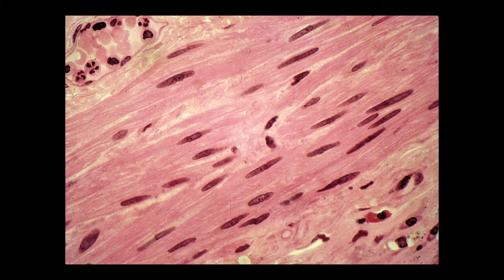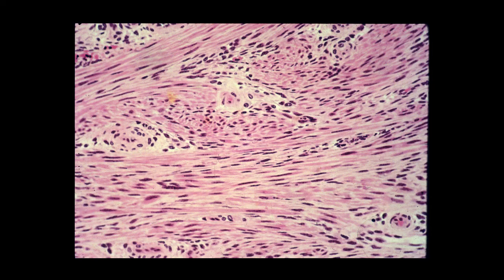venule. You can clearly see red and white blood cells in the lumen, and you can see the endothelial cells that line this blood vessel, and there's connective tissue around the vessel and around this portion of the smooth muscle. A mass of smooth muscle cells shown in this image, and I show this because I'd like you to keep in your mind what smooth muscle looks like in relation to dense irregular or dense regular connective tissue.